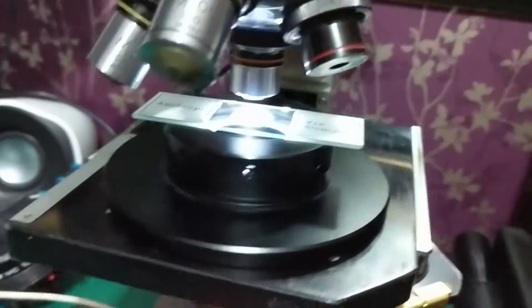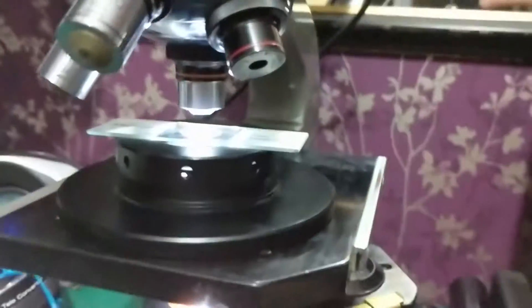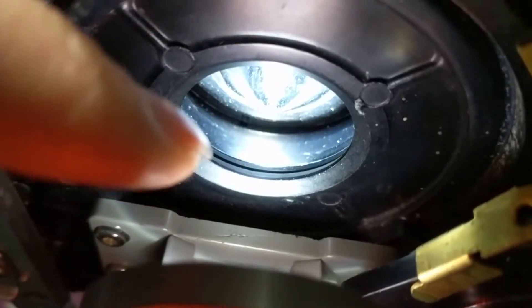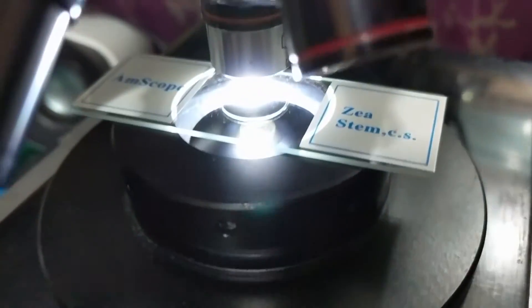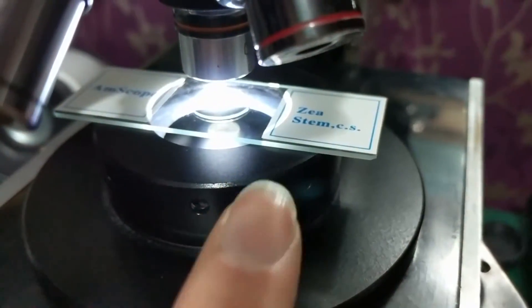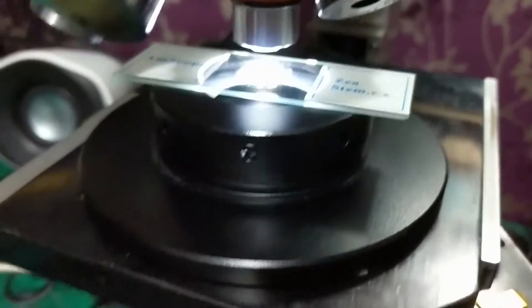It's quite effective — I'll show you how it works in a minute. Basically it has a reflective cone underneath, hopefully you can see that, and that reflects light around the outside and onto the slide above. Below that you've got an occultation disc which unfortunately is a little bit shiny because the finish on this isn't as matte as it perhaps should be.